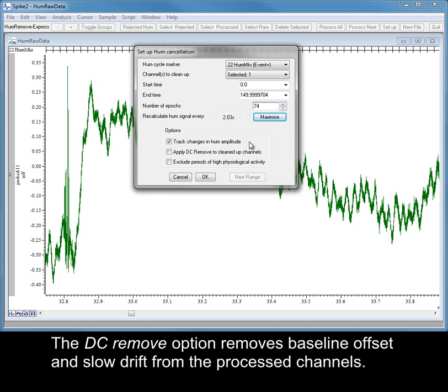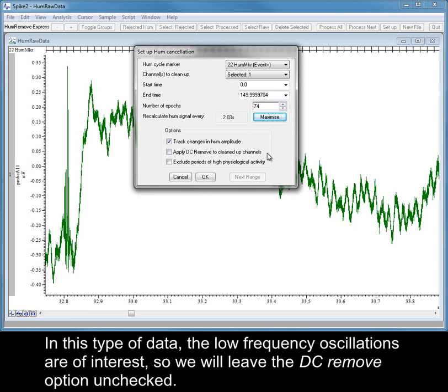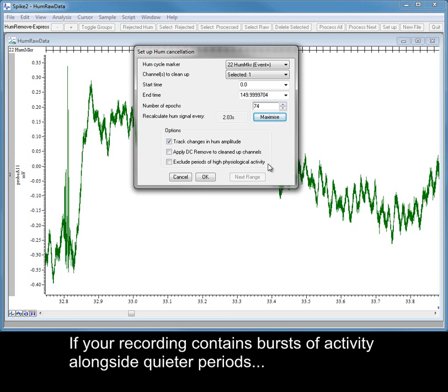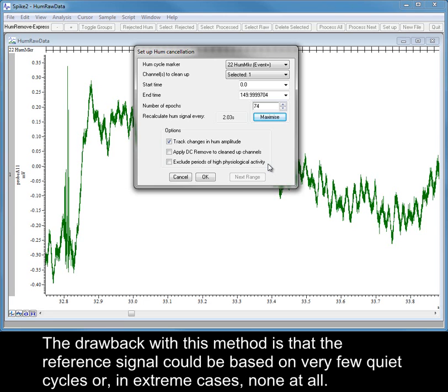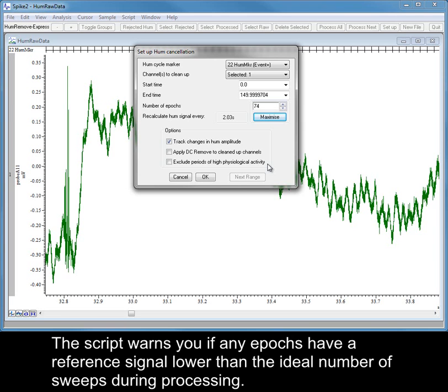The DC Remove option removes baseline offset and slow drift from the processed channels. In this type of data, the low frequency oscillations are of interest, so we will leave the DC Remove option unchecked. If your recording contains bursts of activity alongside quieter periods, you can use the Exclude High Physiological Activity option to base the reference noise measurements on the quiet periods only. The drawback with this method is that the reference signal could be based on very few quiet cycles, or, in extreme cases, none at all. The script warns you if any epochs have a reference signal lower than the ideal number of sweeps during processing.